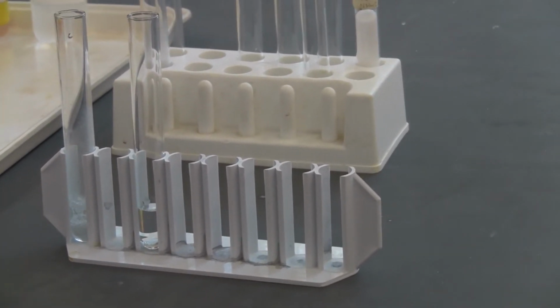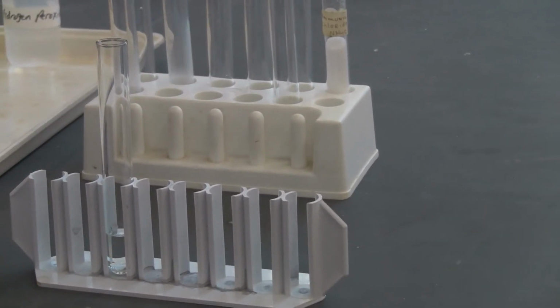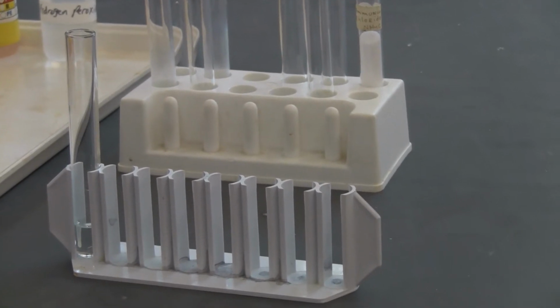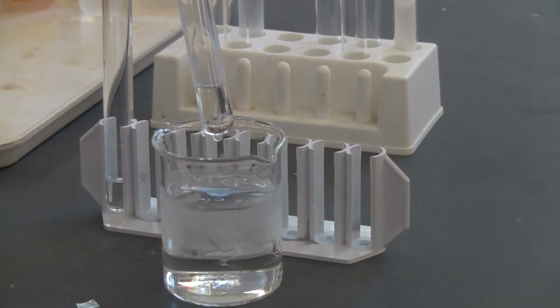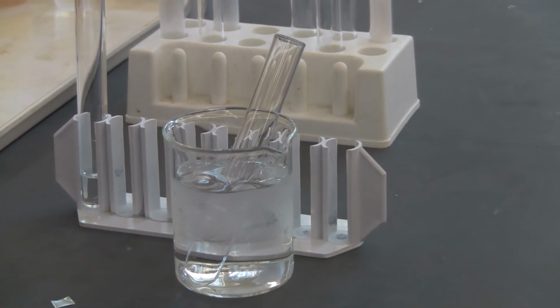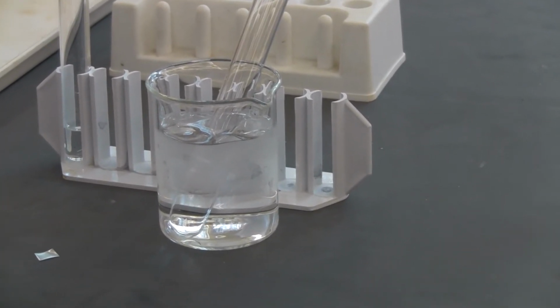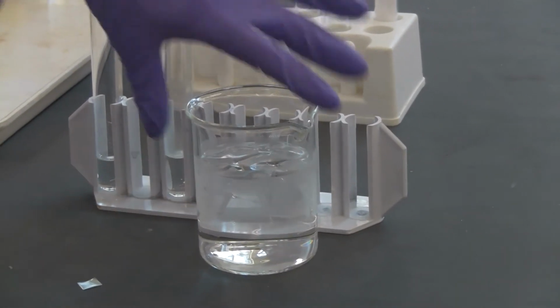We are going to look at the temperature difference. I'm going to take those away. Watch that. This time we're going to have room temperature 6 molar hydrochloric acid, and another one in an ice bath, cold, same concentration, 6 molar hydrochloric acid. What's the difference? Different temperatures. This time I'm going to use the zinc to react again. We're going to see the reaction in there. This one's already cold, so I'm going to take that out, so you know that one is cold.